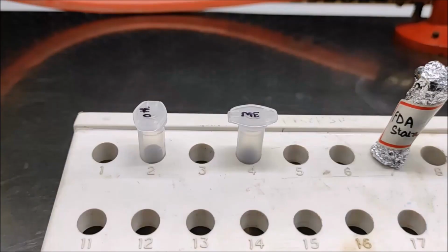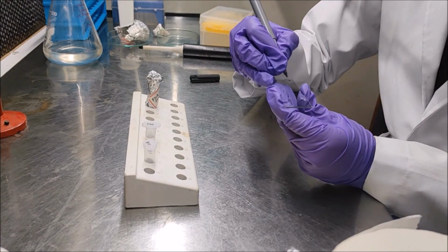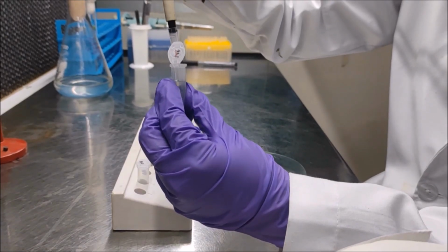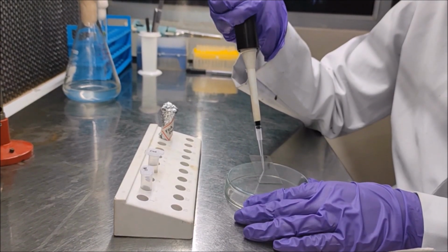Methodology. Initially, cells are observed under microscope to verify cell propagation and to detect the presence of any contamination. To observe the cells, a clean microscopic slide is taken, labeled appropriately, and samples of the cells for the analysis are taken on the microscopic slide.